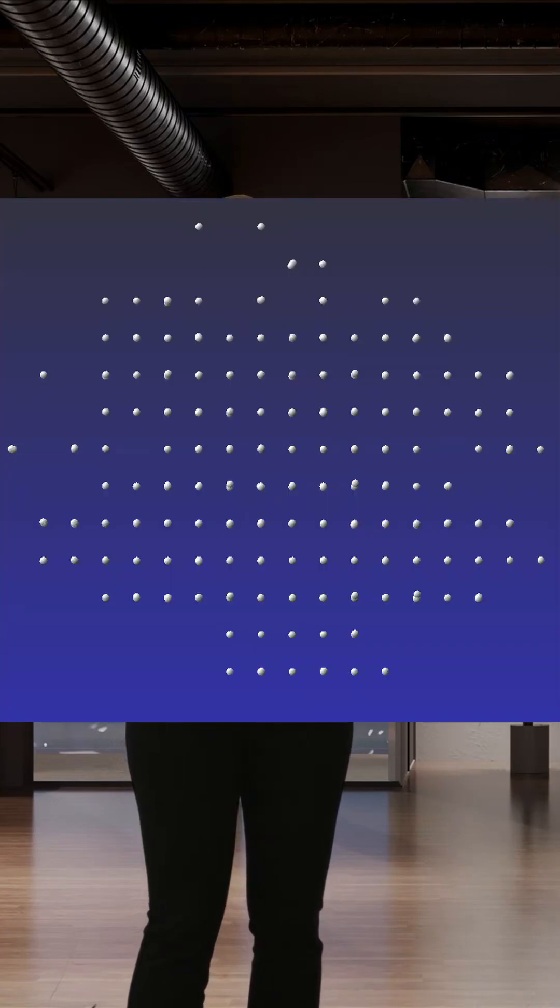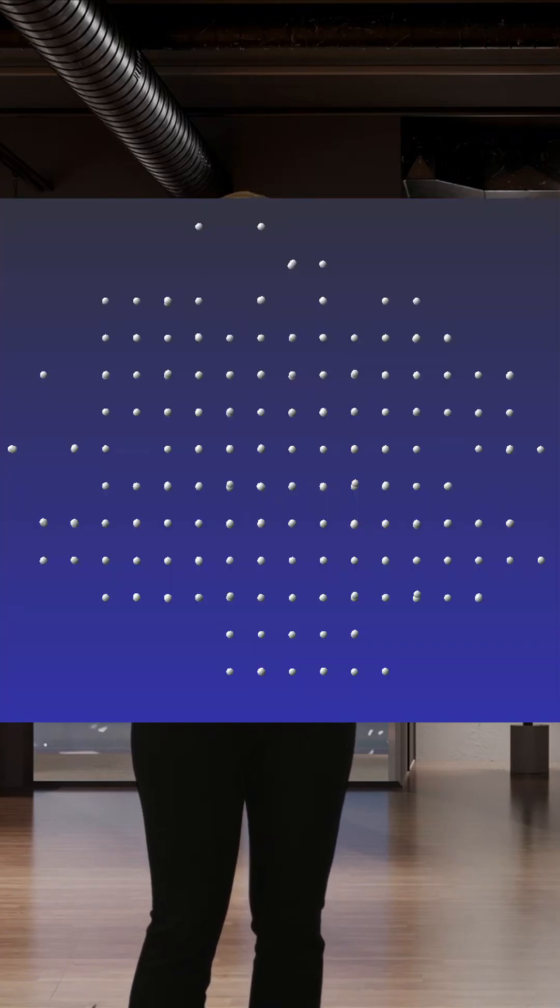After you've collected your fast scan and harvested your reflections, on the left side of the screen click View Reciprocal Lattice. This will show you those harvested reflections and you can even see them line up in their beautiful lattice planes.